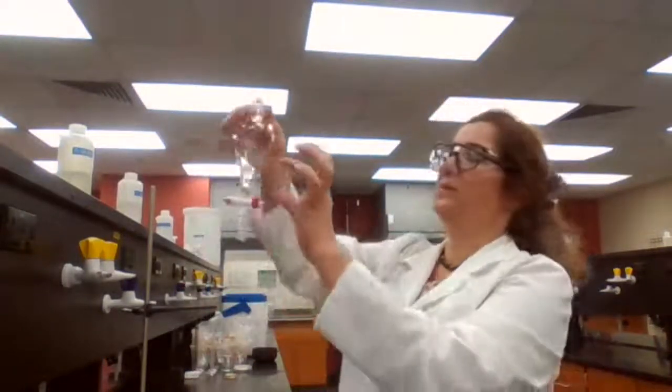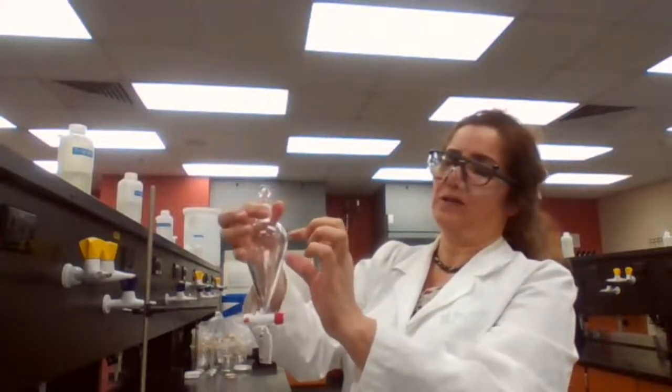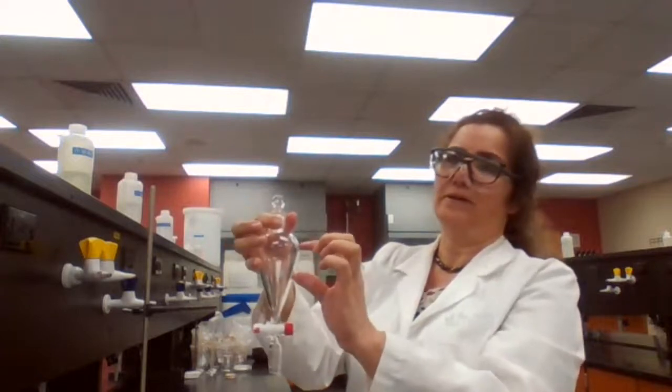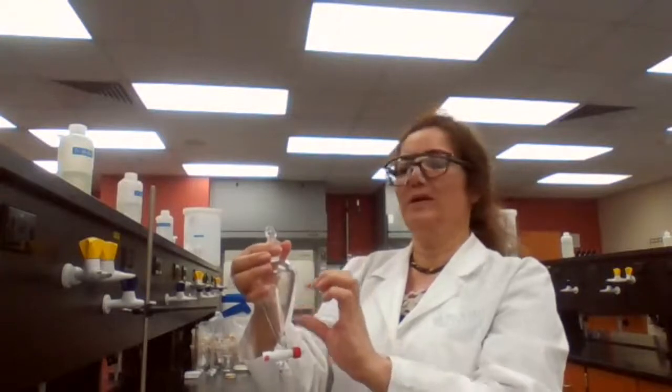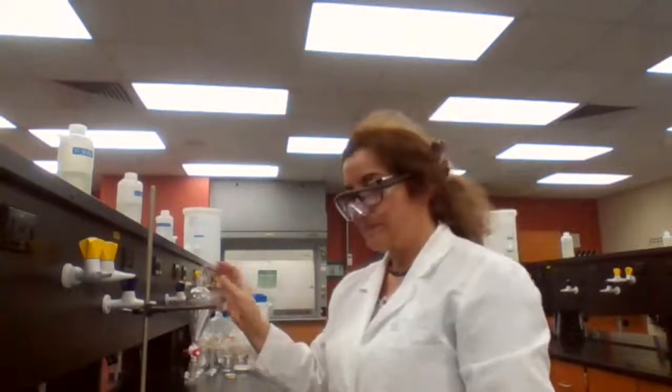So if you have two immiscible liquids in a separatory funnel with different density, the liquid with the higher density would be at the bottom layer, and the liquid with the lower density would be the top layer. Because we have two immiscible layers, one has to be organic and one has to be aqueous, and it's not guaranteed that the top layer is always the organic layer. Only if you are using ether as the extracting solvent: since ether has lower density than water, ether would be the top layer. The aqueous solution is going to be the bottom layer.